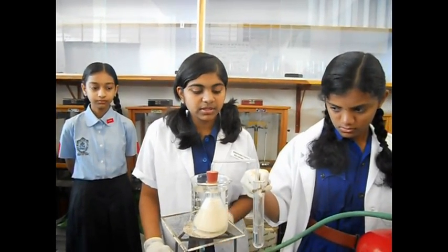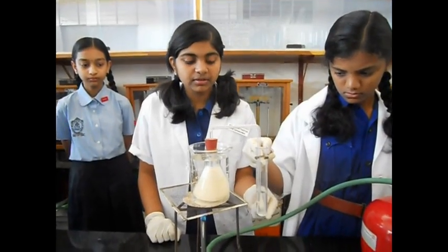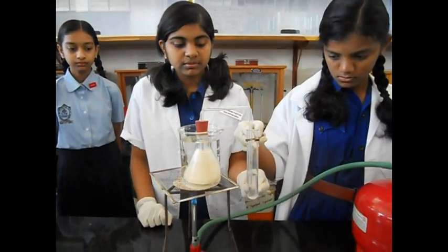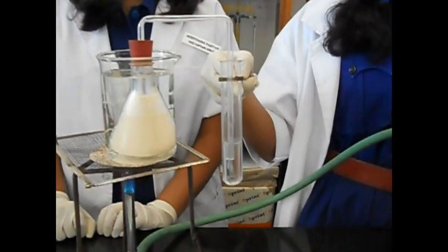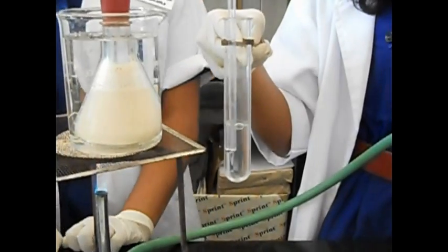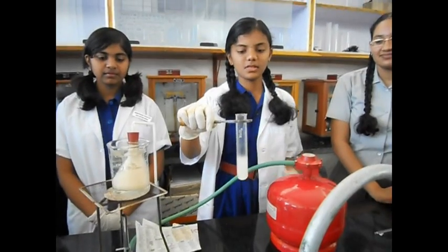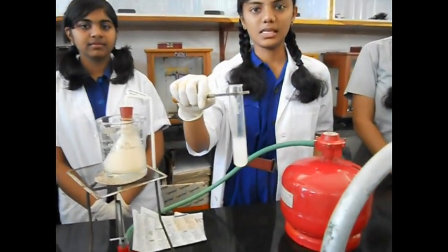We can now observe carbon dioxide gas evolving out of the conical flask and passing into the lime water. We observe that the lime water has turned milky.